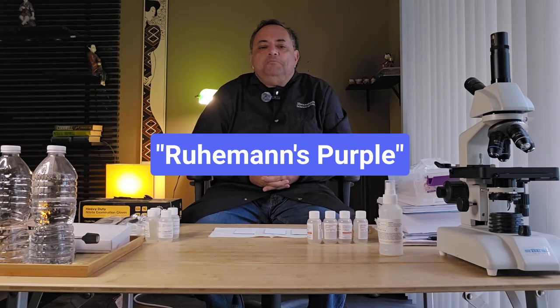Ninhydrin is a powerful oxidizing agent and reacts with the amino group, resulting in a deep blue or purple color. This is commonly referred to as Ruhemann's purple reaction. In some cases, a yellow color is observed, especially with proline due to its cyclic nature. But today, proline is not one of the amino acids we are looking at.